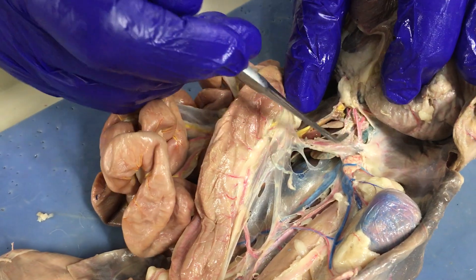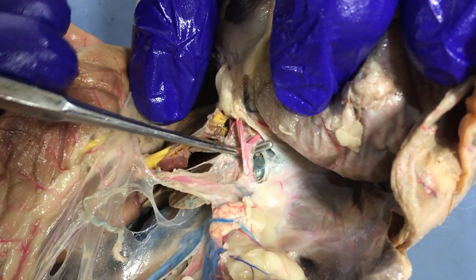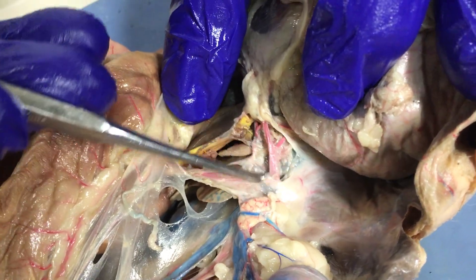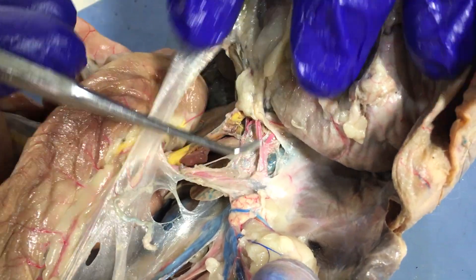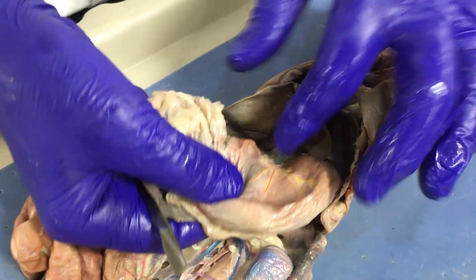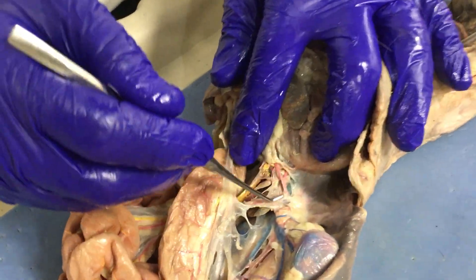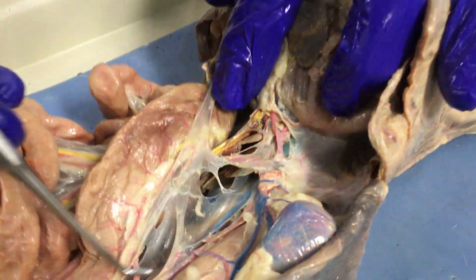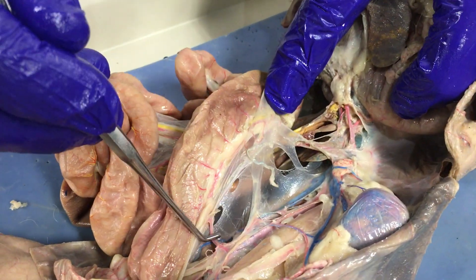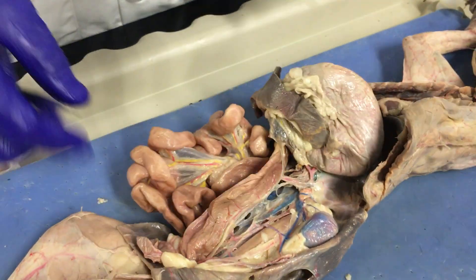Superior mesenteric. This is the celiac trunk artery, which is delivering blood to the spleen, the stomach, and the liver. So these are your oxygenated blood — three arteries that deliver to all of the digestive organs.